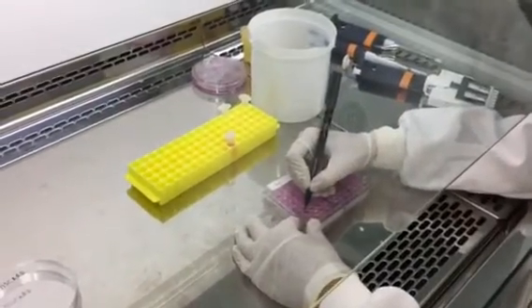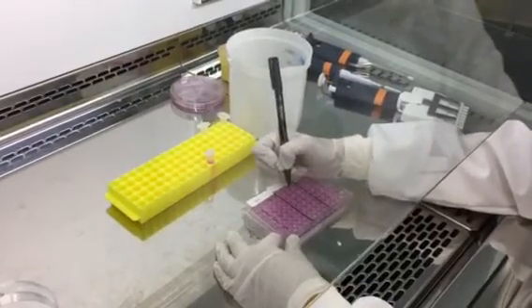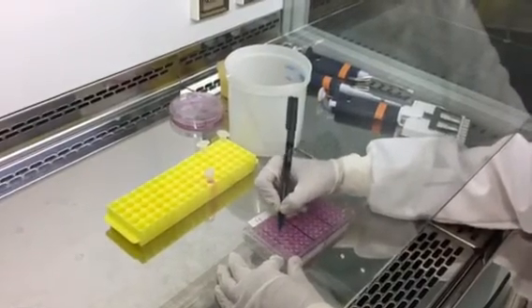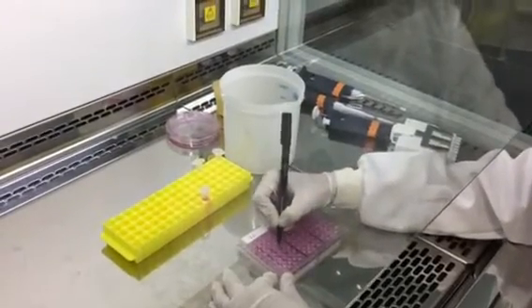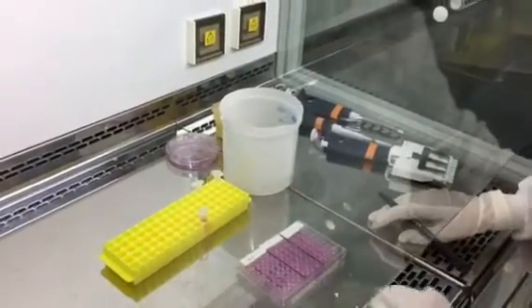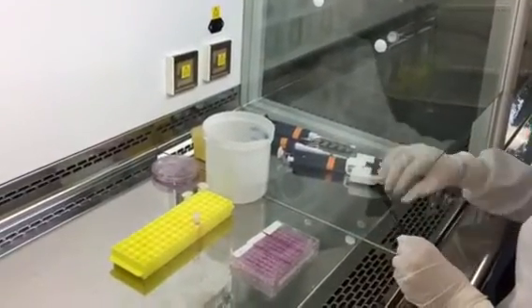The next thing you do is label entire columns with the treatment. The column on the left is your no drug control, then your next lowest concentration is 0.1 millimolar of the drug, followed by 1 millimolar drug, and lastly 10 millimolar drug. After that's done, you can start with transferring the medium.